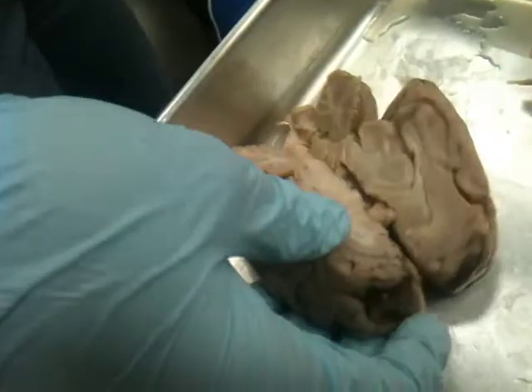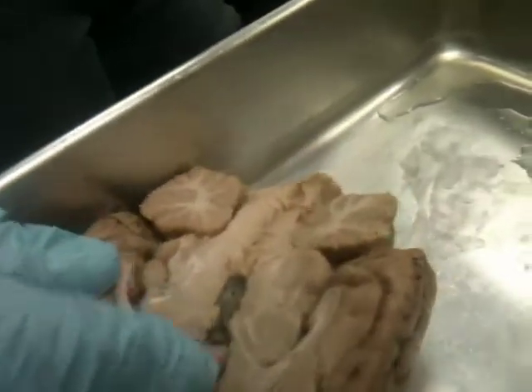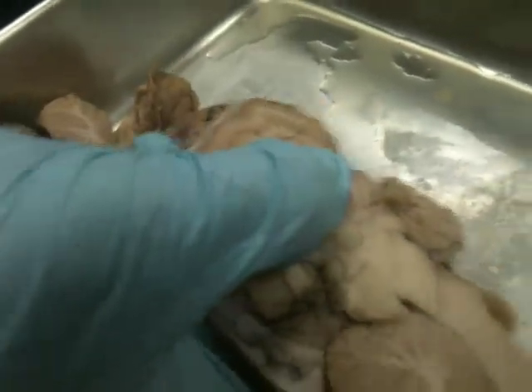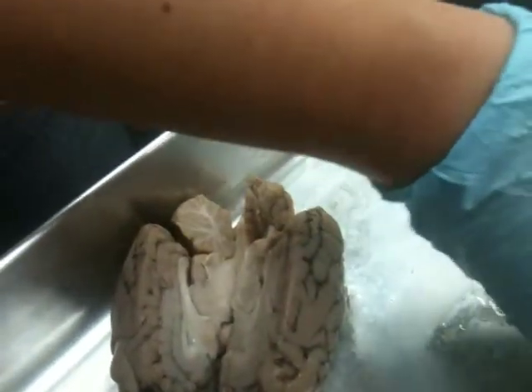Okay? And then below the thalamus, on the hypothalamus, you have this stuff right here, which we usually cut all the way through. You can see it better on this one. Right, so see that little part coming off the bottom? Yeah. That's the optic chiasma. It's part of the optic nerve. You can see it from underneath as well. See it coming up like that?